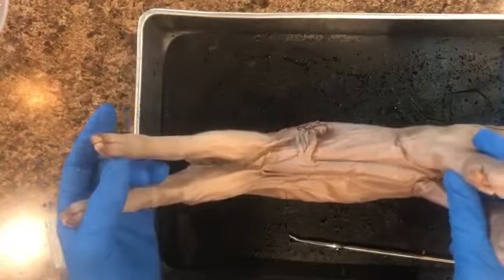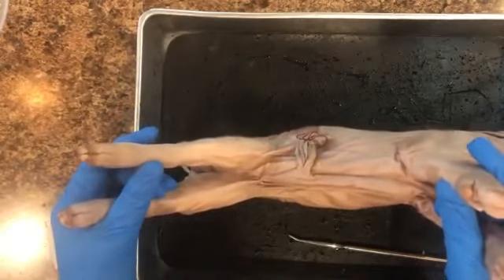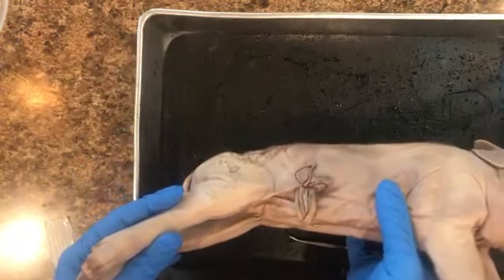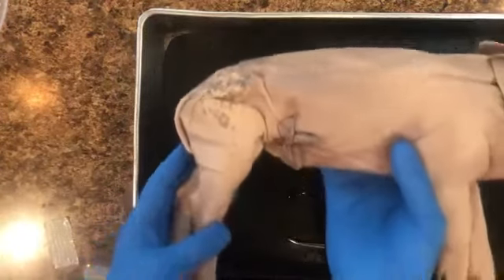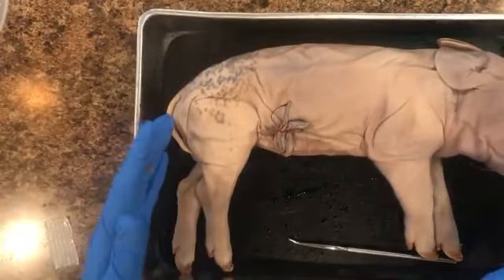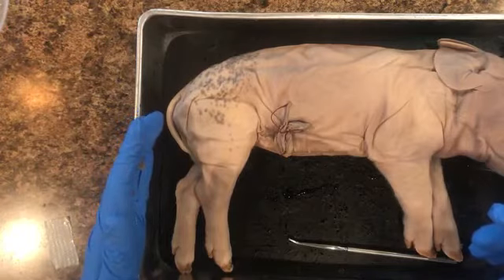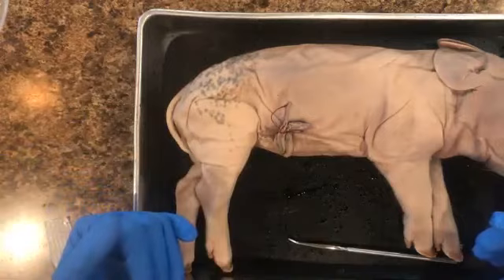Okay, so do you think it is a boy or a girl? You will make that hypothesis, and we are moving on here. So yesterday's assignment, one of the questions said, how can you tell if it's a male or female pig? And someone's response was not what I expected, but I enjoyed it. It said something like, well, a female will more like squat, or you will be able to see the urine coming out closer to the butt, whereas a male is more underneath the belly where you will see the urine coming from. So I thought that was kind of cool.